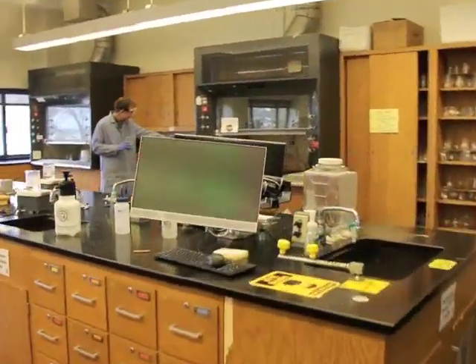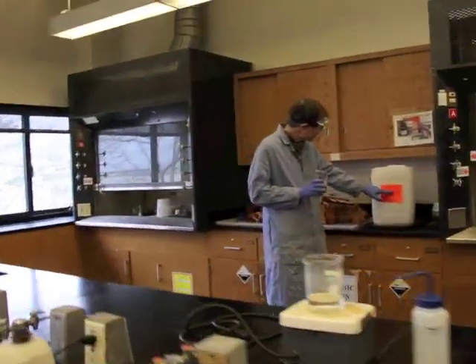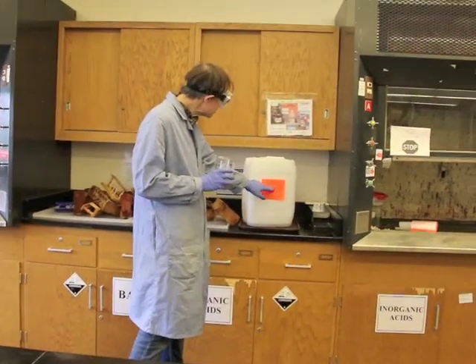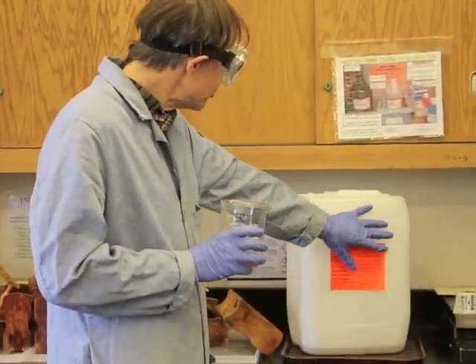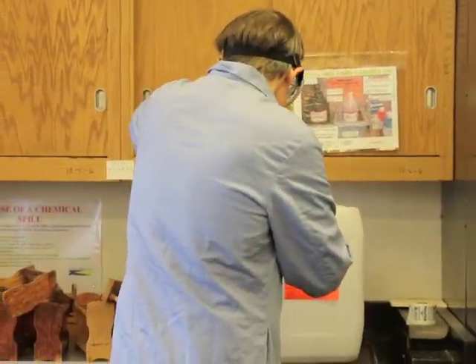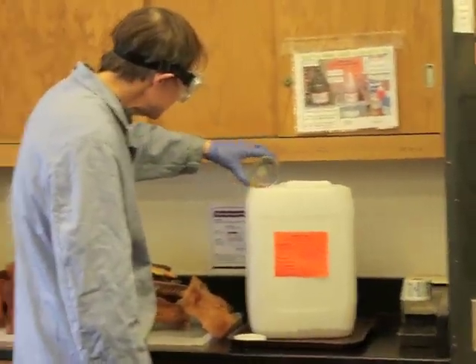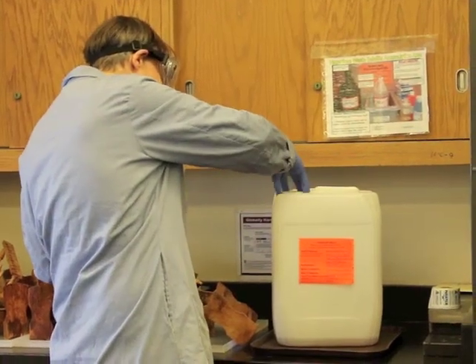This room waste container has an orange slip on it. It's indicating what reagents we're adding. That way we know at the college what to do with the solution, how we deal with it. Are we going to put it into one bottle or another? And so I'm going to open this up. I'm going to pour the waste in. And then I'm going to close the container up.